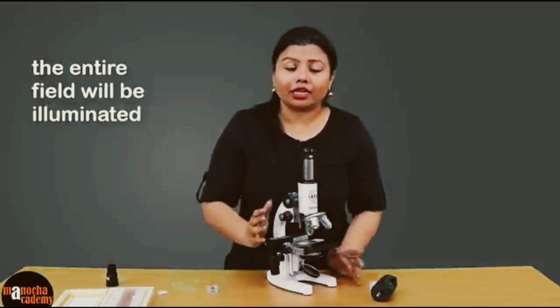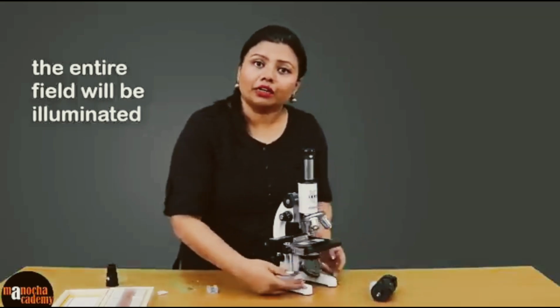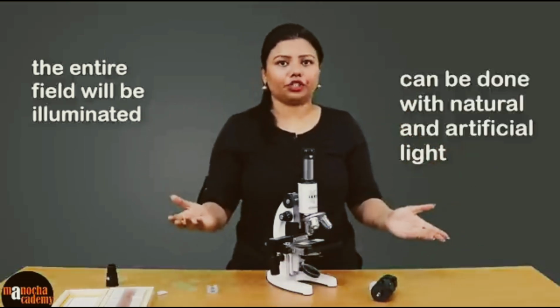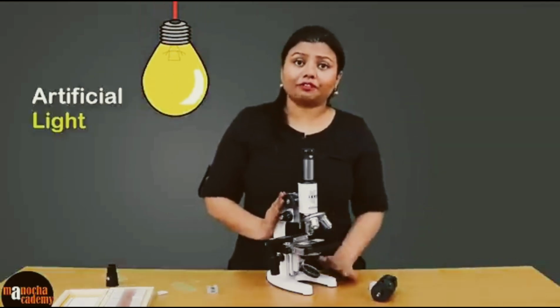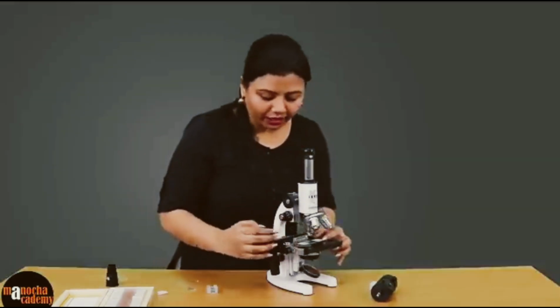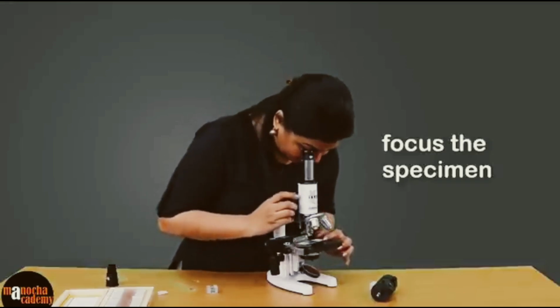It is not dark, it is not black. The mirror will be able to collect light from natural or artificial sources. You can do this in front of an artificial light, or in front of a window through which sunlight is coming in, right? Then you start adjusting your focus by moving the coarse adjustment screw.